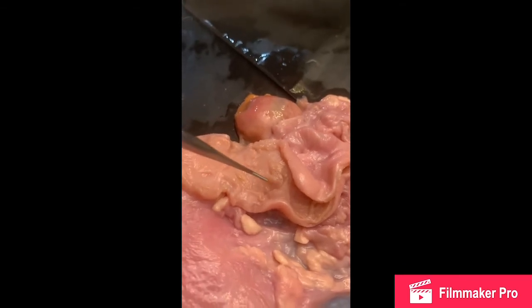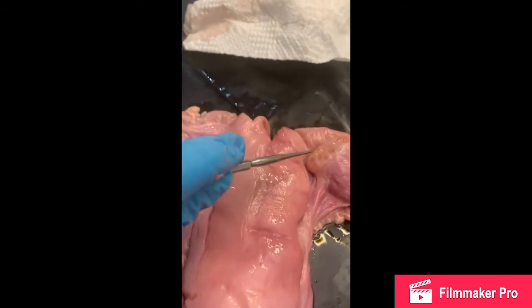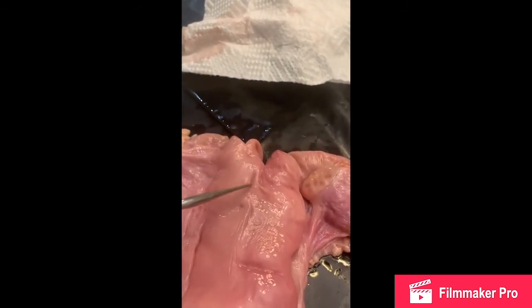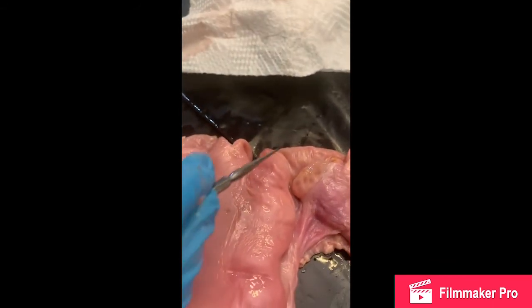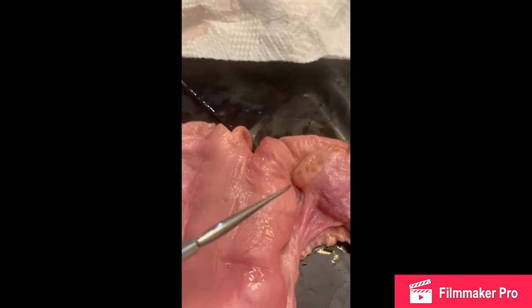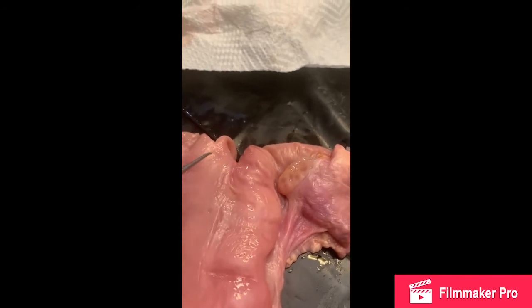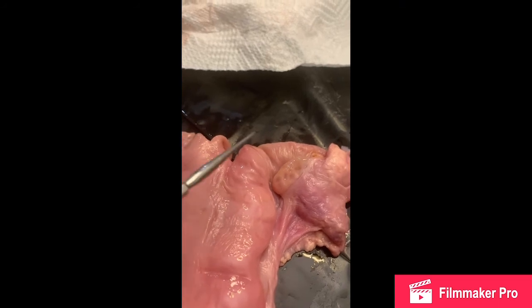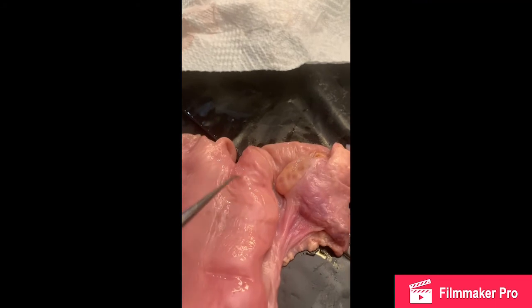Okay, so we flipped it over, and we can see where it's connected with the uterine horn. We're going to have our mesometrium, which will be right here. You can kind of see, and this mesometrium is how our placentas are going to receive their nutrients, as well as expel waste if we have a placenta with the baby. And so yeah, it's going to be right in here.